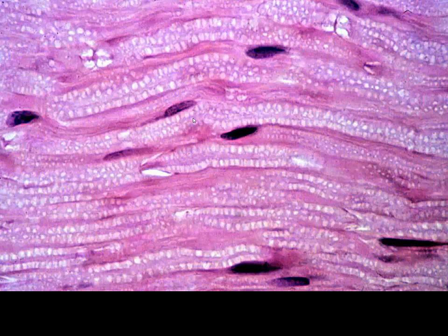Now, this is a much higher magnification, and we can see those little butterfly structures that we see here. But then we have these bubbles all along the length, especially these larger spaces that we see here. We have some spaces here that almost look like arrowheads or points. These are called Schmidt-Lanterman clefts.